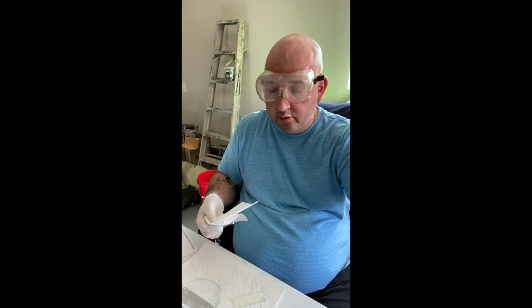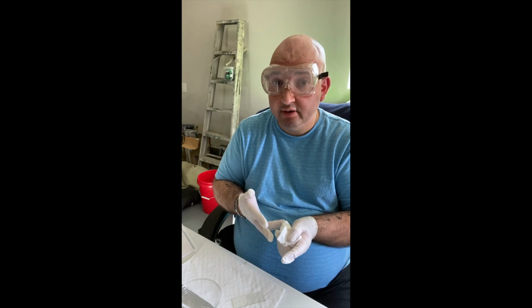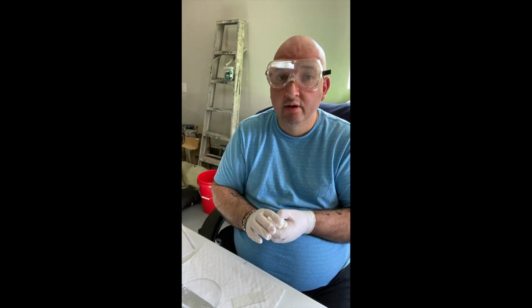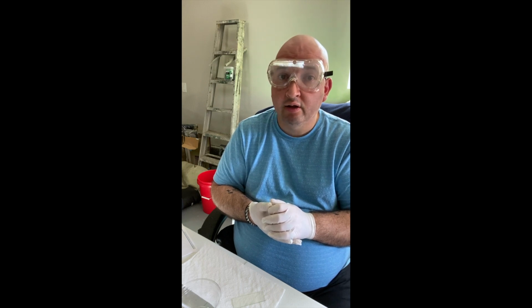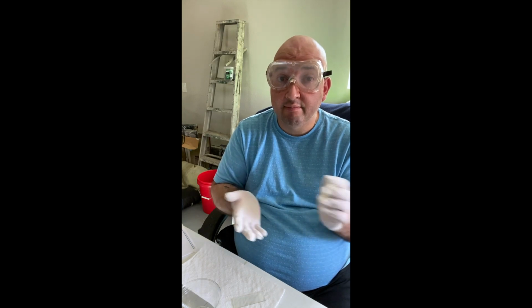and cheek. So at this point, my next step is to take some photographs of these as is and then place them under the microscope for the optimal power. Steps that are really kind of hard to talk about as I'm doing them via the microscope, but I will upload photographs of these and my completed report.